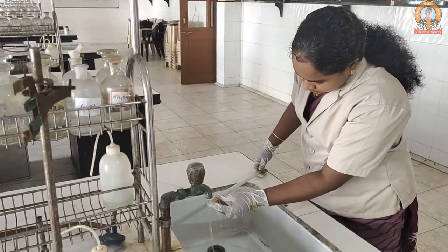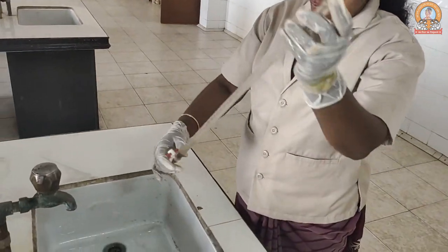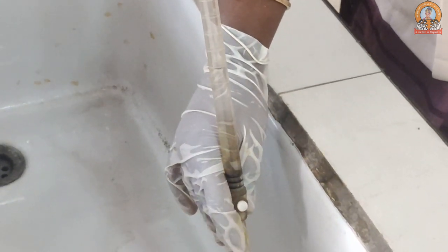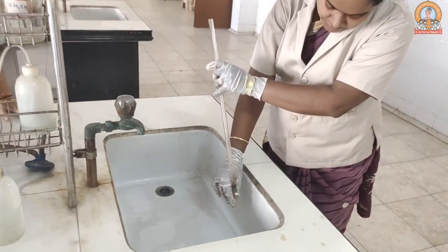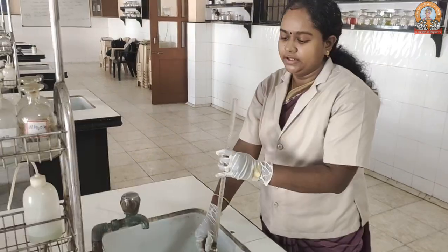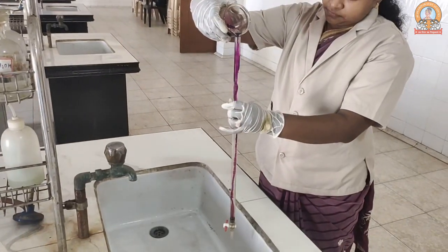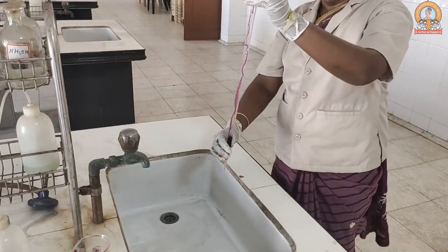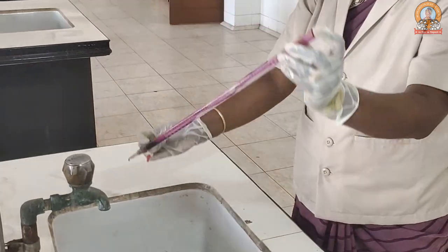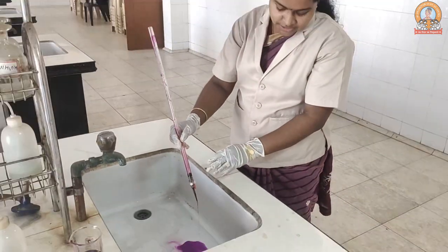First, wash the burette with water so that all impurities can be removed. Rinse it well and let it pour off. This helps remove impurities, and then you rinse it with the KMnO₄ solution. This can be done two to three times. Then pour in the KMnO₄ solution into the burette and rinse it in the same manner. This removes the water molecules used for purification.